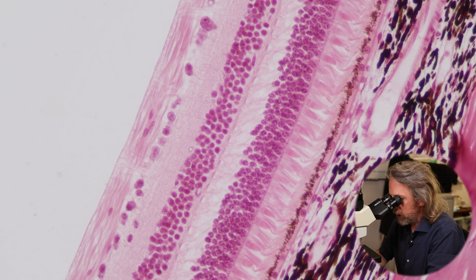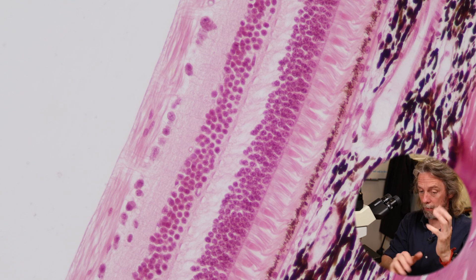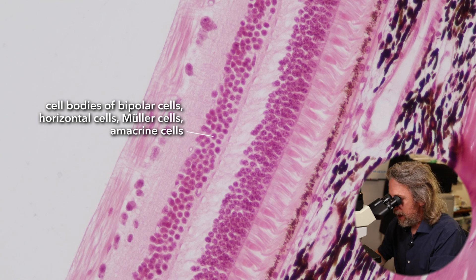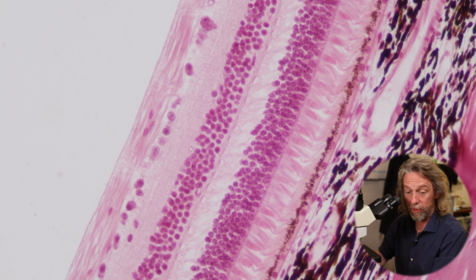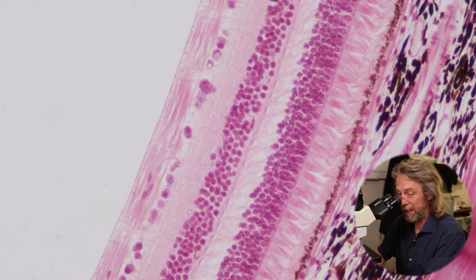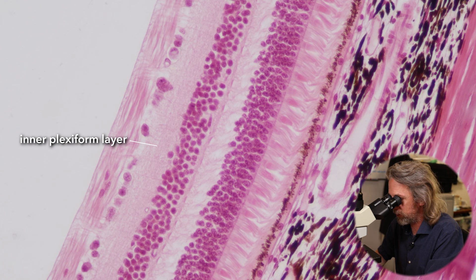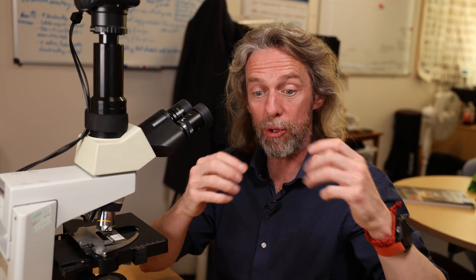Bipolar neurons and horizontal neurons are going to carry the action potentials that have been generated by the photoreceptor cells onwards. So if that outer plexiform layer has the processes of horizontal cells and bipolar cells - those intermediate neurons - then the next layer where we see those nuclei, those are the nuclei, the cell bodies of the bipolar and horizontal cells. So that's the inner nuclear layer. The outer nuclear layer is closer to the pigmented layer, the outer surface of the eyeball. The inner nuclear layer is closer to the centre of the eyeball.